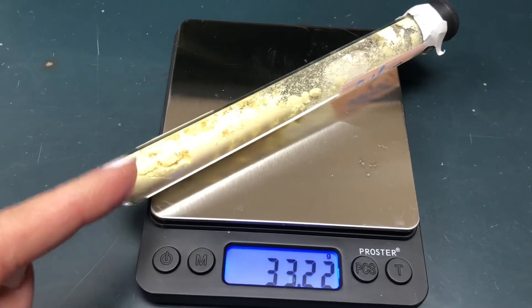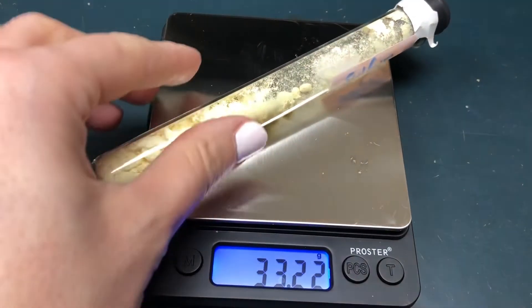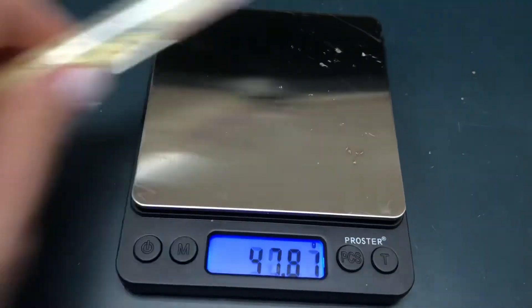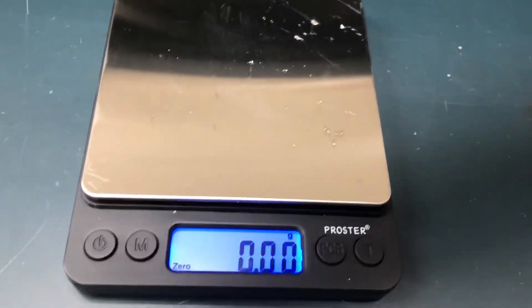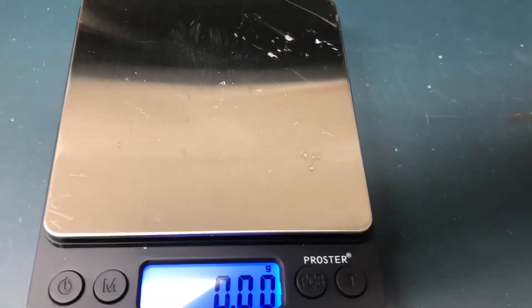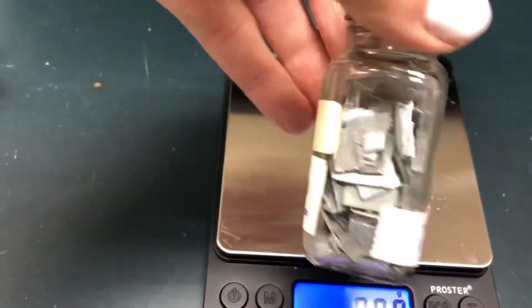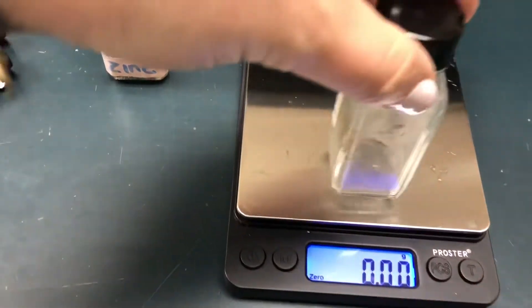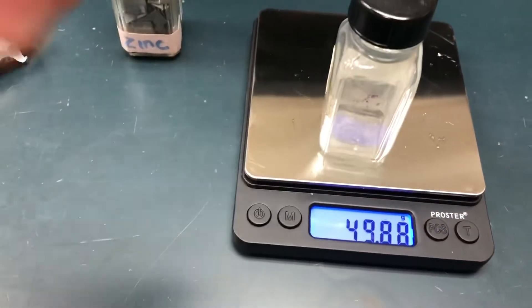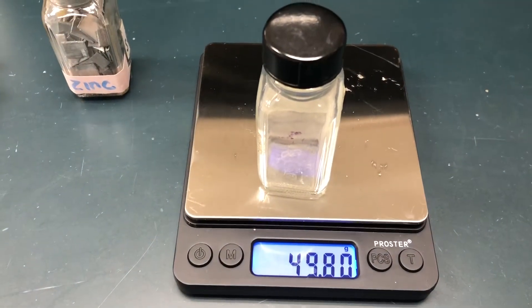For the next station's data we have zinc — you can see a bunch of zinc pieces in here. I've got the empty bottle, so my empty bottle with my cap.